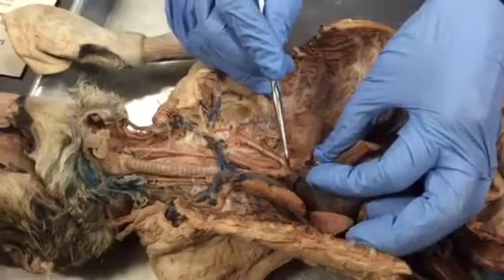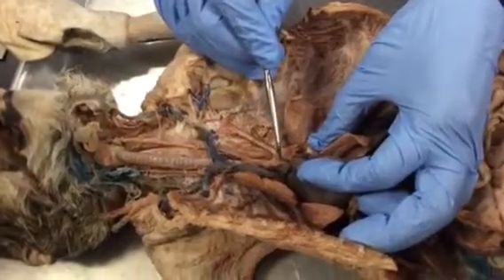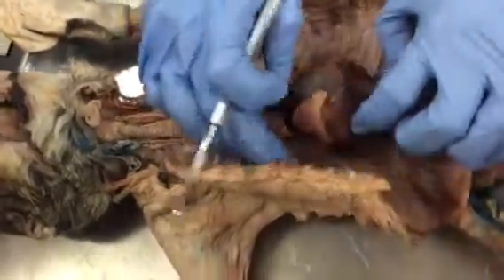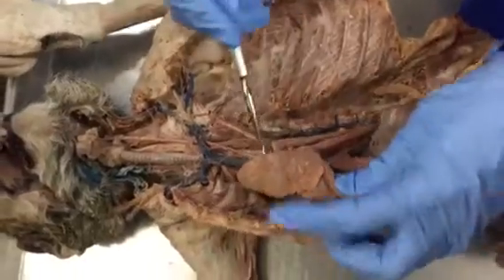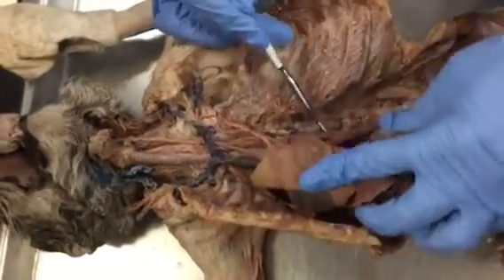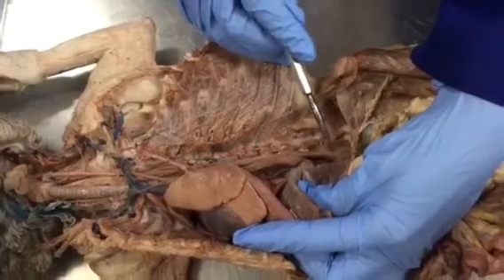And see, the aorta is coming out from the left ventricle, and then it is going down, like it makes a question mark, goes down, and it becomes the thoracic aorta. So if you see from here, see thoracic aorta. So this is also aorta. This is all aorta, and this is thoracic aorta because it is located in the thoracic cavity, and below the diaphragm is the abdominal aorta.